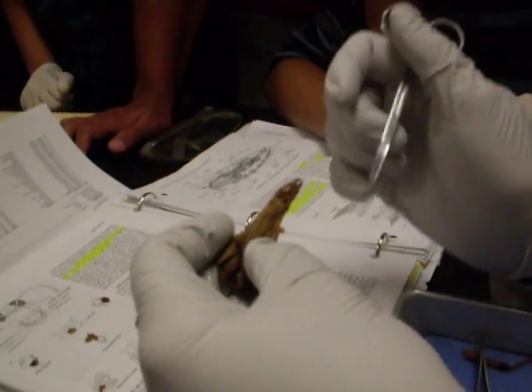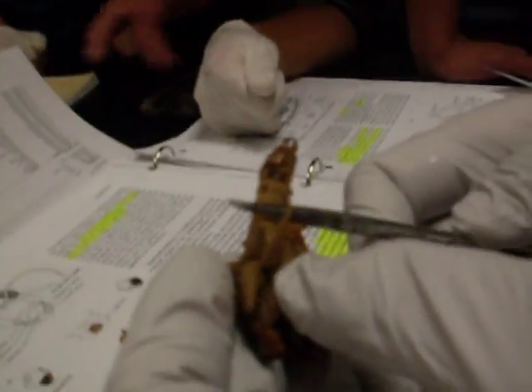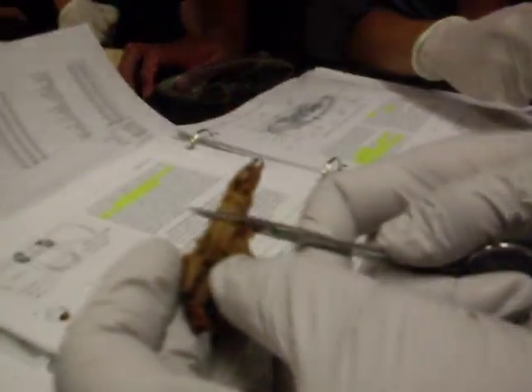Okay, this long area here, this first area — what's this first area called? Mid-gut. Mid-gut. Second area? Colon. Colon.